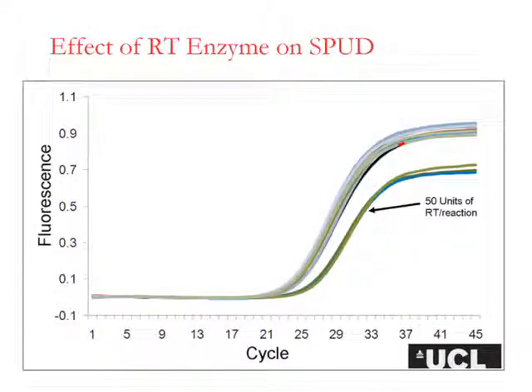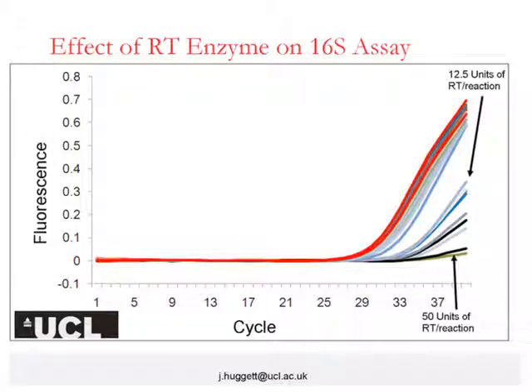Jim Huggett's work went one step further to then examine the relative effect of RT enzyme on different templates, or different sequences of template. So here you can see the effect of 50 units of RT within a reaction on the SPUD template, whereas in this data you can now see the effect of the RT enzyme on a 16S assay. And you can see that the 16S assay is much more sensitive to the remaining presence of RT within an assay. Once again demonstrating that different assays have a different sensitivity to the same inhibitor within a sample, and of course meaning then that relative quantifications of different targets will be perturbed in the presence of any inhibitors.